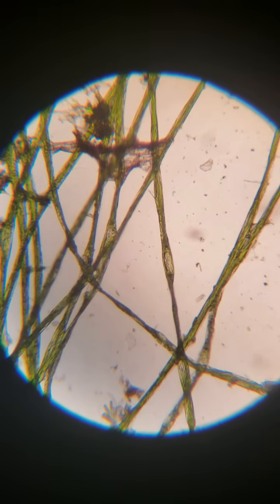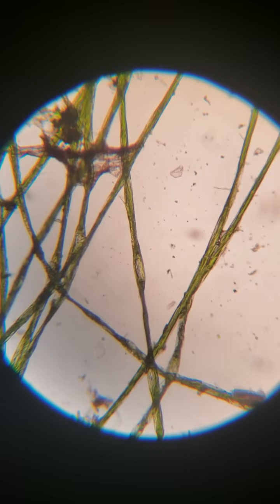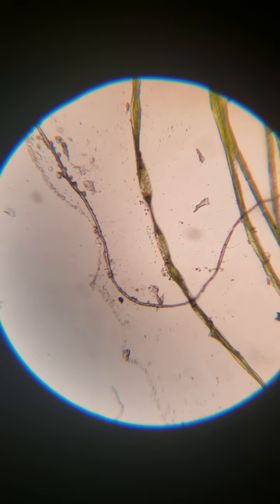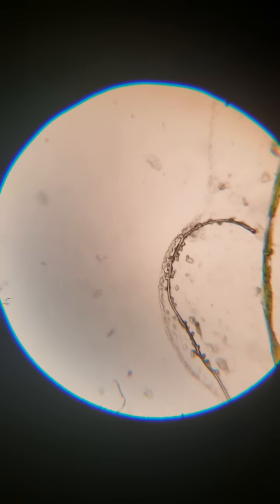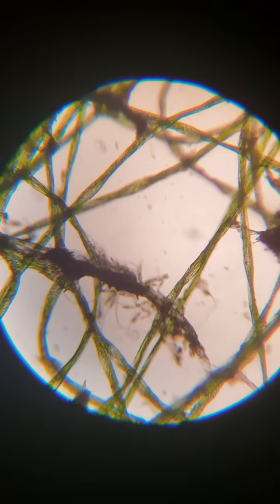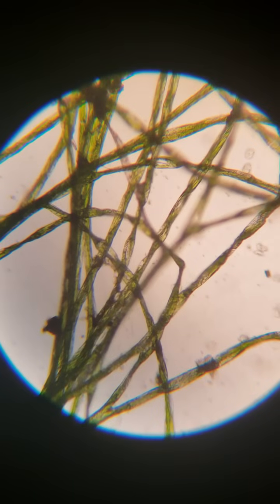Nodules on the string algae that allow it to break off and split into multiple pieces, puts different cells and liquids and things in there, and it's kind of just like a little network rest stop or interchange spot. Also over here you can see the same kind of thing going on in a different kind of algae, but they all have super clear cell walls. You see these very specific lines in this stuff, and when we look at it, they're usually long, spindly cells.